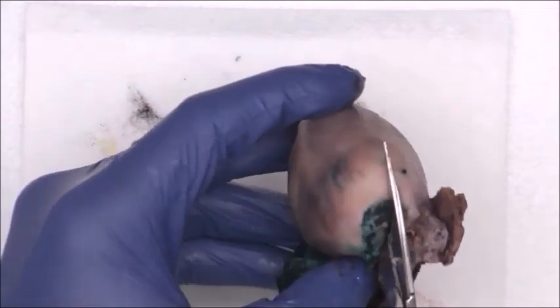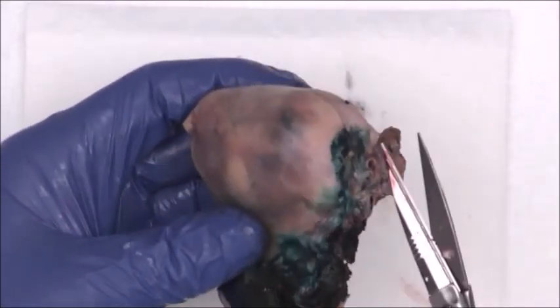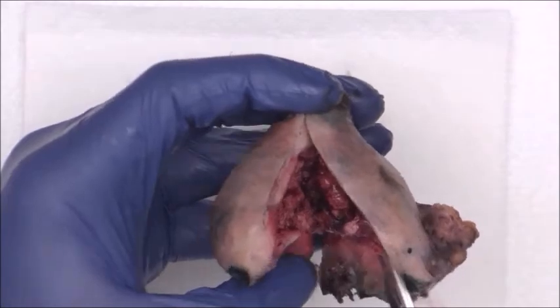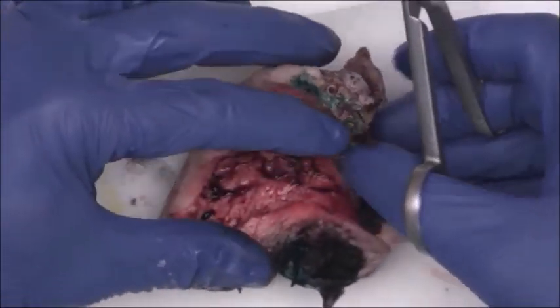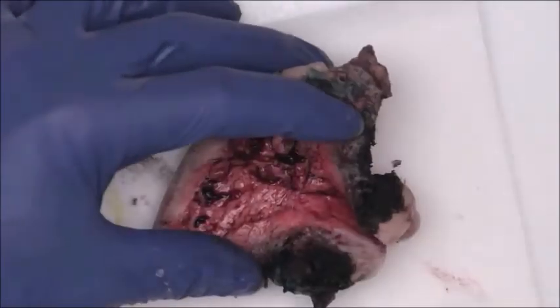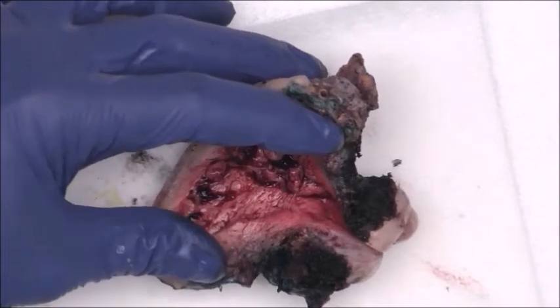So I'm just going to cut along, cutting from the cervix up the right side, okay, and we're going to continue cutting until I get about right here. And then what I like to do next, so we've got that lesion on the other side, we've got to be mindful of that lesion over there. Turn on the water. It's always good to have some running water, especially if you have a friable tumor.